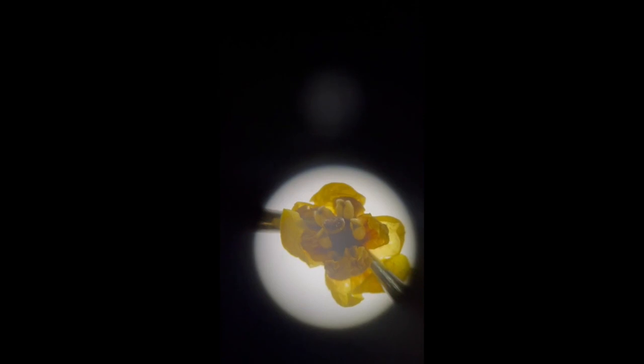Okay, here we have a good view of the gynoecium, and we can see a superior ovary. So it looks like one carpel. We'll do a cross section and find out. So here's the cross section, and you can see a unilocular carpel with marginal placentation. Okay, so here we have a nice view of the longitudinal cross section, and you can see it just confirms marginal placentation and one carpel.